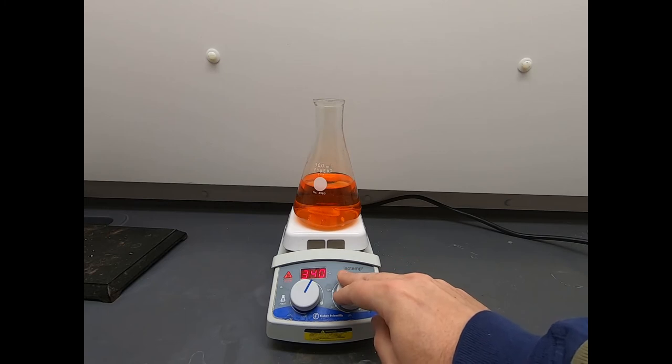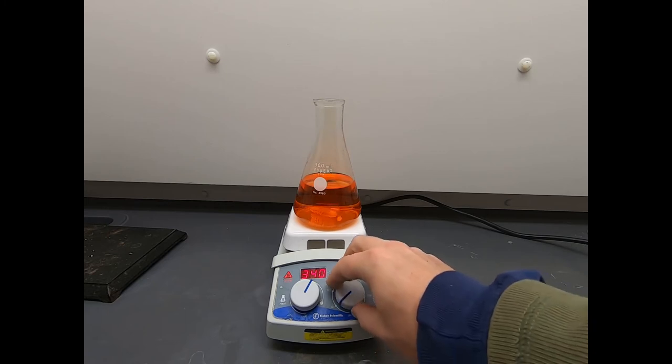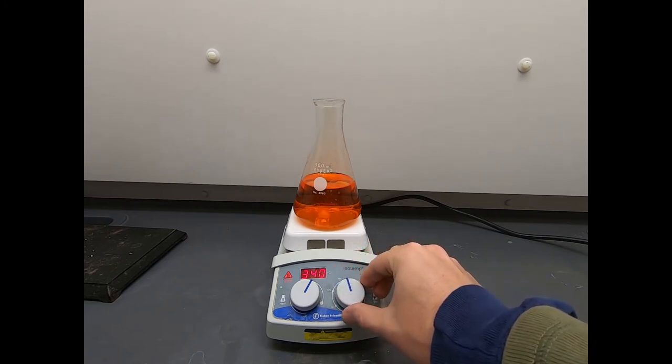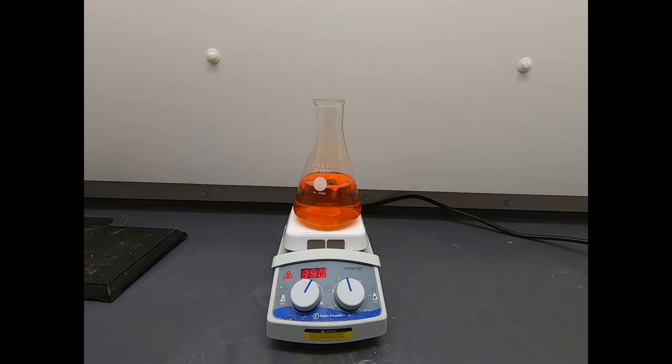So let's turn this down. Still no boiling. Okay, we're going to let this go a little bit more. I think all those bits will go into solution, and then we'll see what comes next.